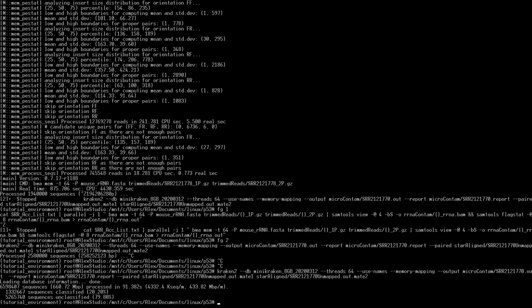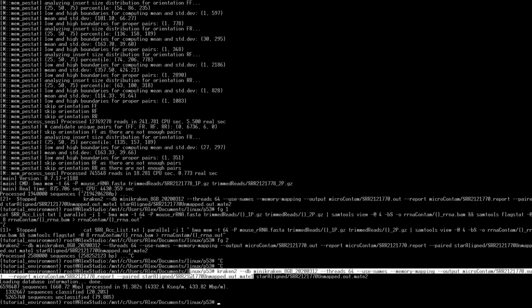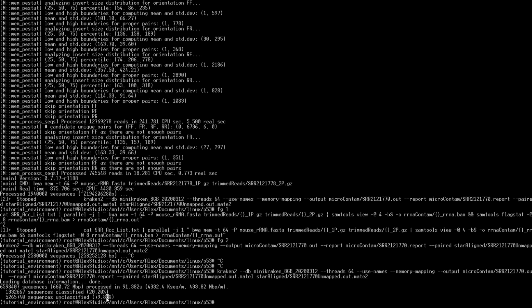All right, so now Kraken is done. Here we can see 80% of our reads that were unmapped from aligning with STAR didn't align here either. But the Kraken database isn't entirely comprehensive. It's only 8 gigabytes. They say it's a subset, I'm pretty sure. But we can see here that 20% of the reads did map to something in that Kraken data.